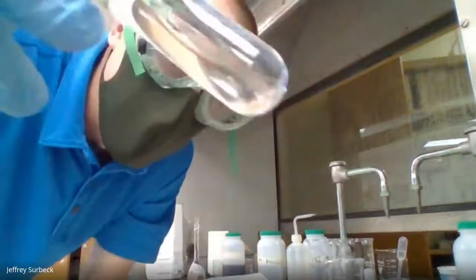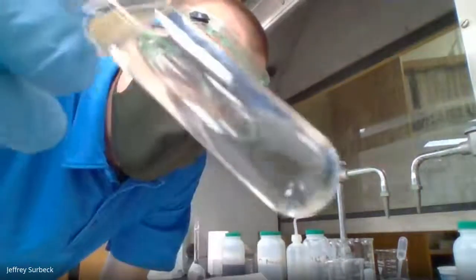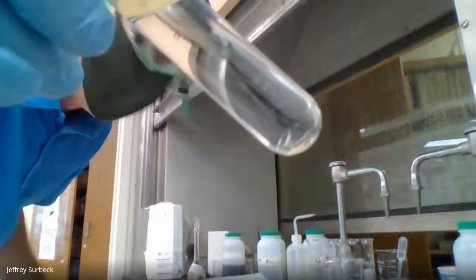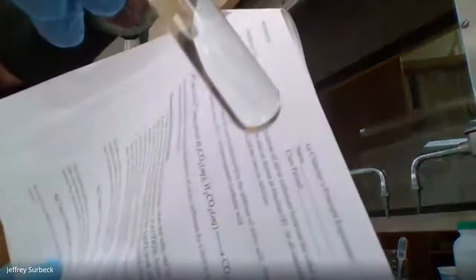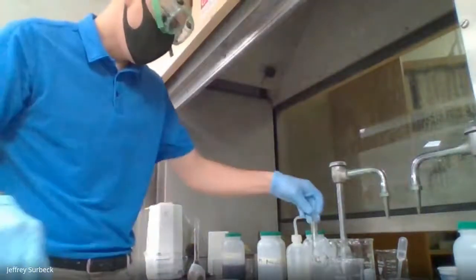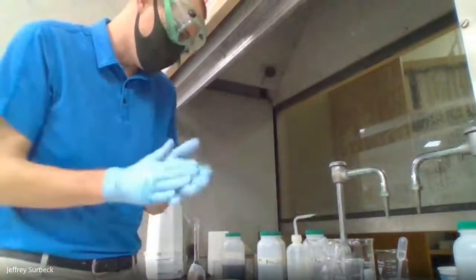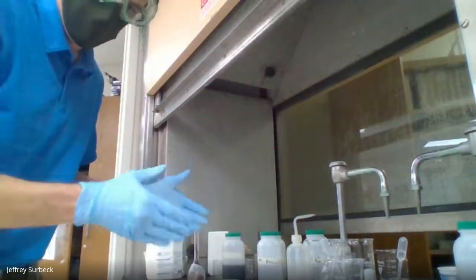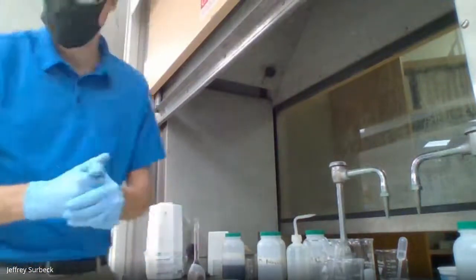But with this right here, again, this is extremely light green. So we went back to this light green color. I know you probably can't see it from the video, but this is a light green color. Let's see if we can get any background now. It is very, very clear, but it does have a light green hue. All right, so I'm going to get another new test tube. Remember, number 6, it should be light green. So we went from a light green to a purple to a light green on that second part.